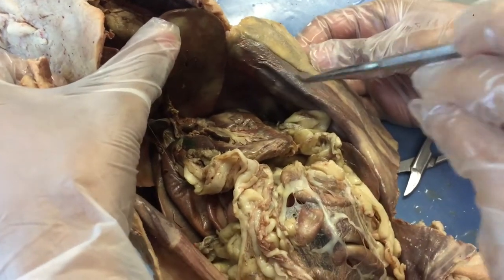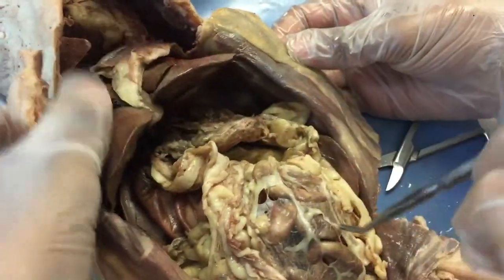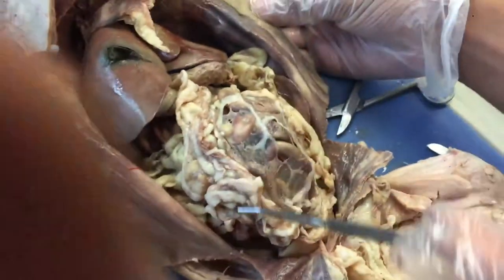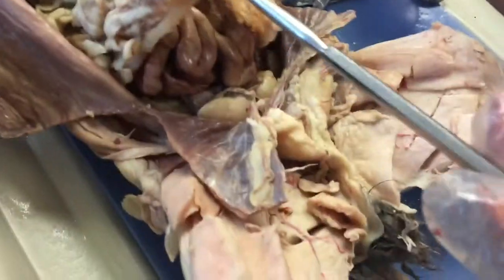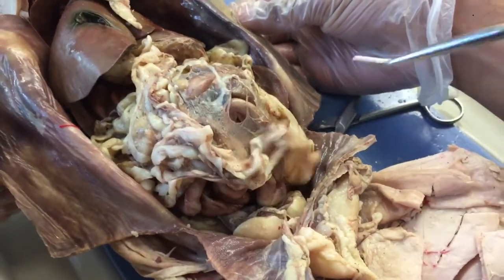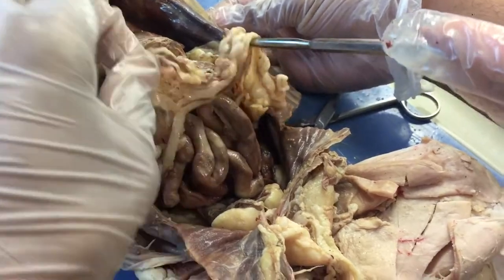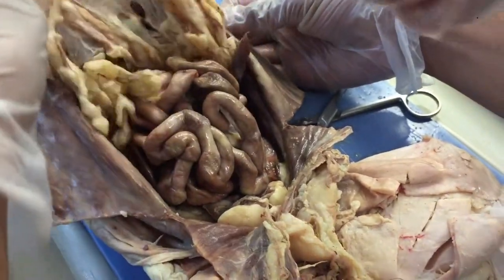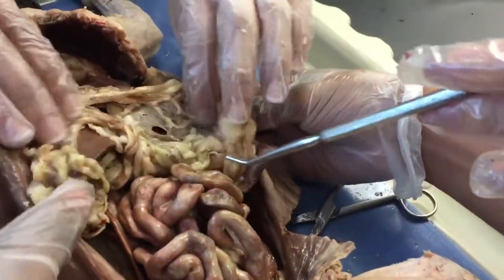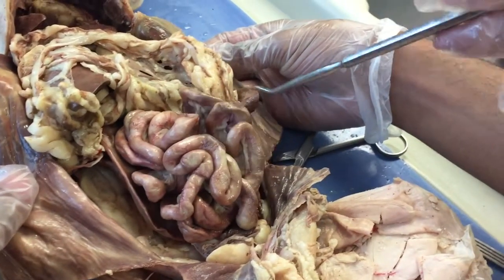Moving on, we have this layer of fatty tissue called the omentum, and it basically protects the small intestines. Lifting that up, you see the small intestines, which is most of where the absorption happens.